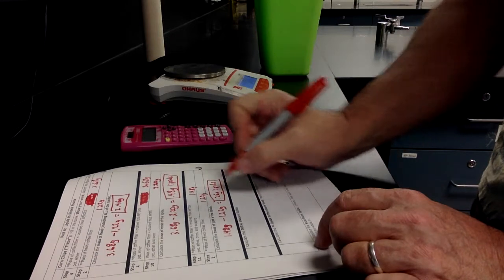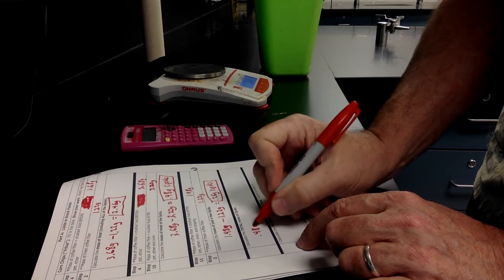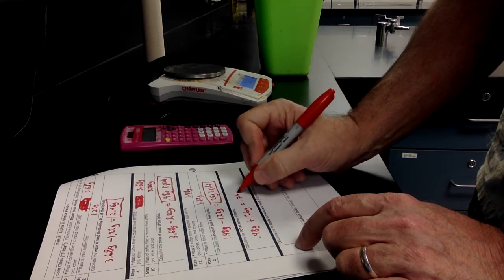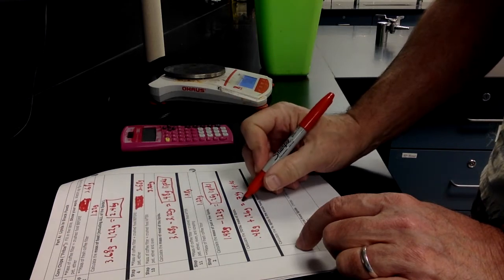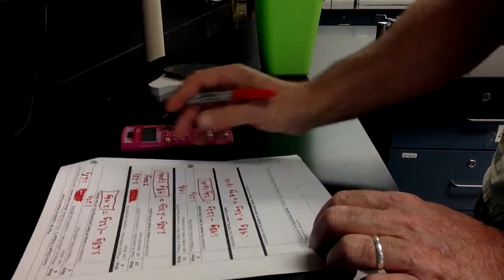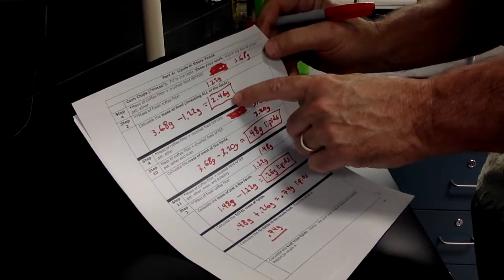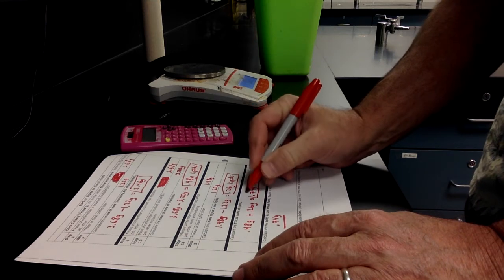So now we're going to total up the mass of the lipids from the first and second part there, 0.48 grams plus 0.26 grams. And it's telling us that our Fritos had 0.74 grams of lipids in it. So our Fritos contain 0.74 grams of lipids. Now the percent would be dividing the 0.74 grams of lipids by the total mass of the food before we did anything to it, which was 2.46.